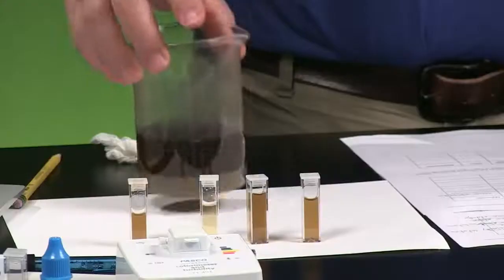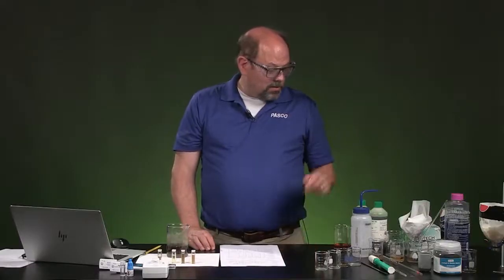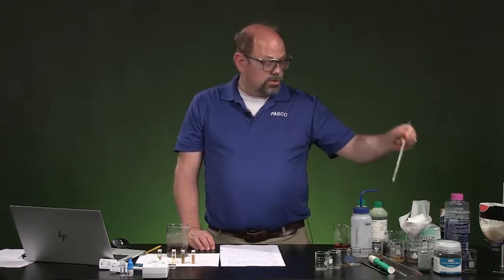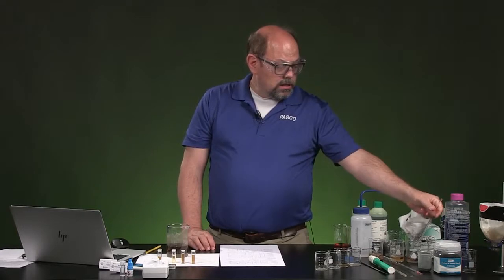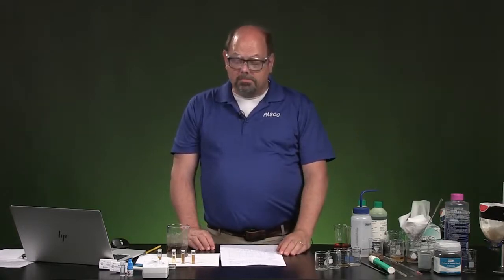That could have come from even the last little bit of stirring that I had done when we kept using this. Because at one point, I stirred those two solutions that we checked the calibration for the pH sensor.